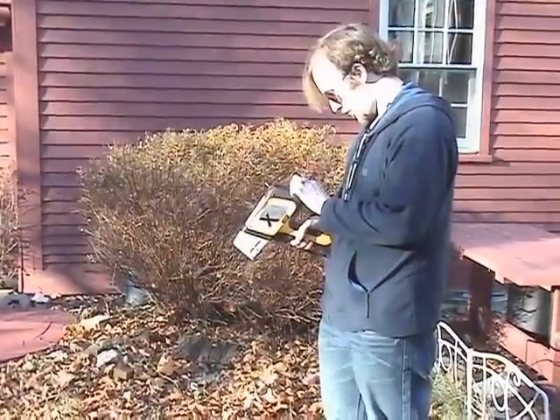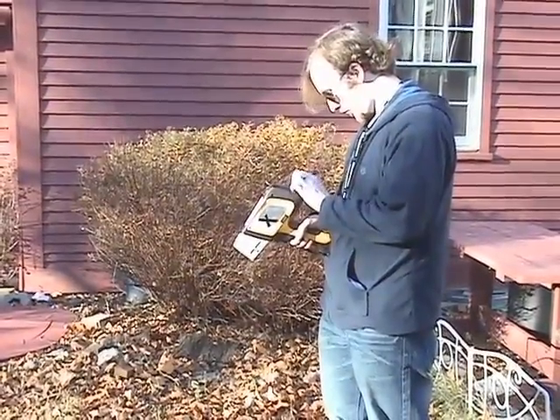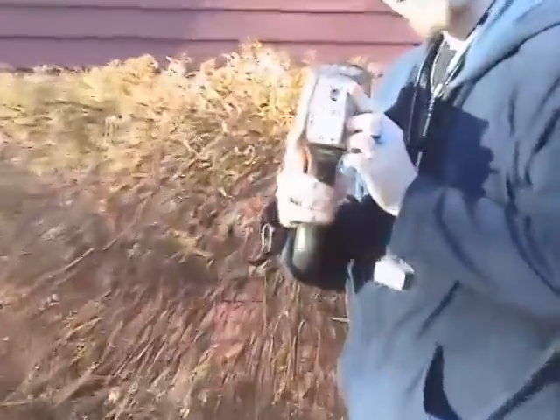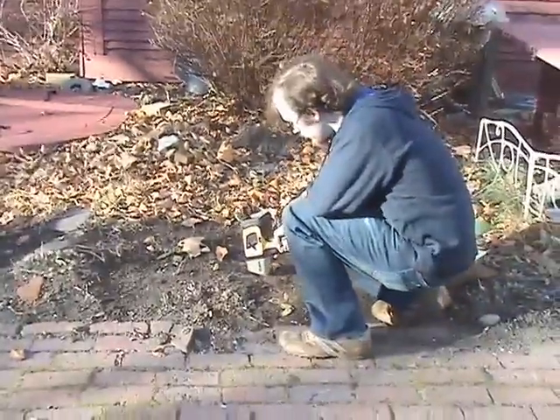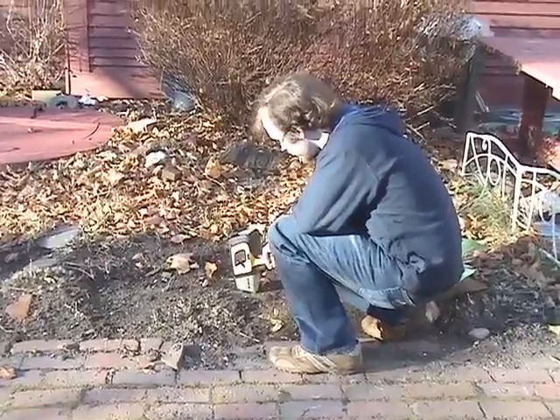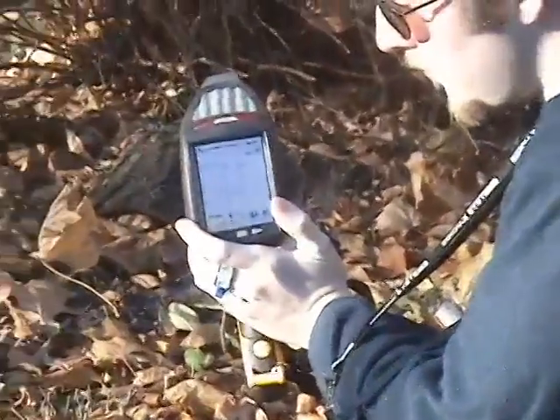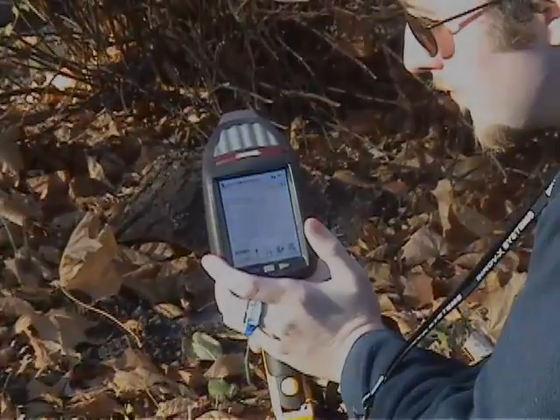Handheld XRF is an ideal tool for quickly screening soil for toxic metals. Simply place the analyzer window on the soil, press the trigger, and read the display. Test results can be seen in seconds, which help to determine the next course of action if caution or remediation is necessary.